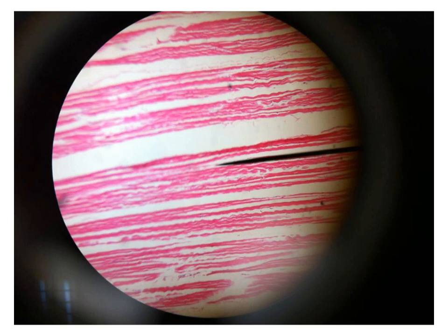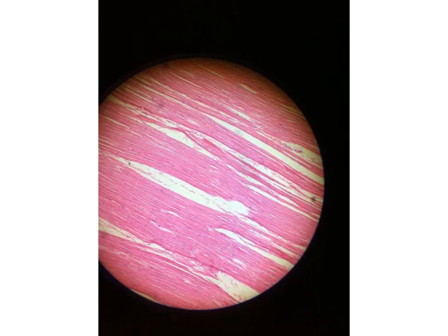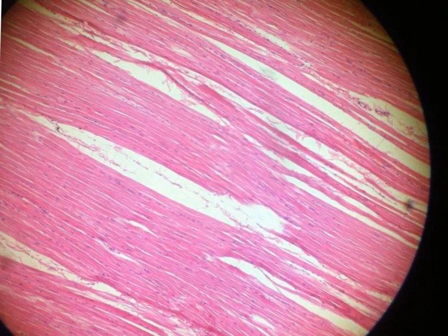Again, this is the LS in the skeletal muscle, an elongated structure formed of parallel red muscle fibers, and of course you know that these white areas represent the destroyed connective tissue in between the muscle fibers during the preparation. Again, it is LS skeletal muscle fibers, but let us concentrate slightly.